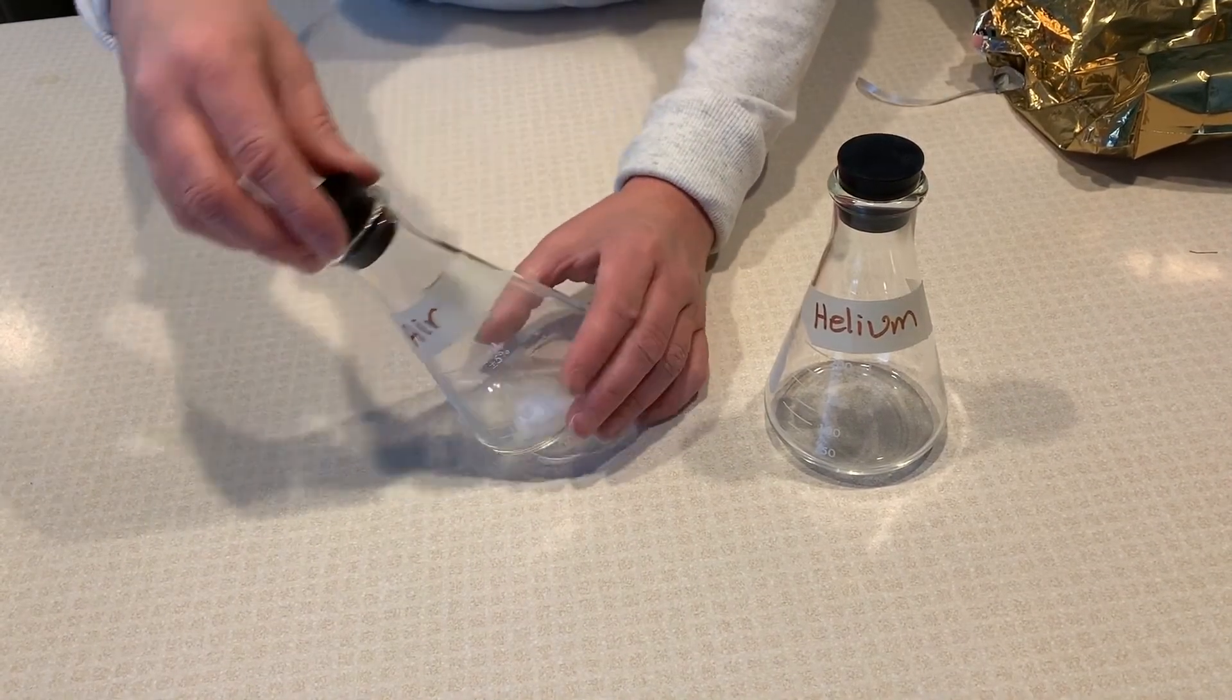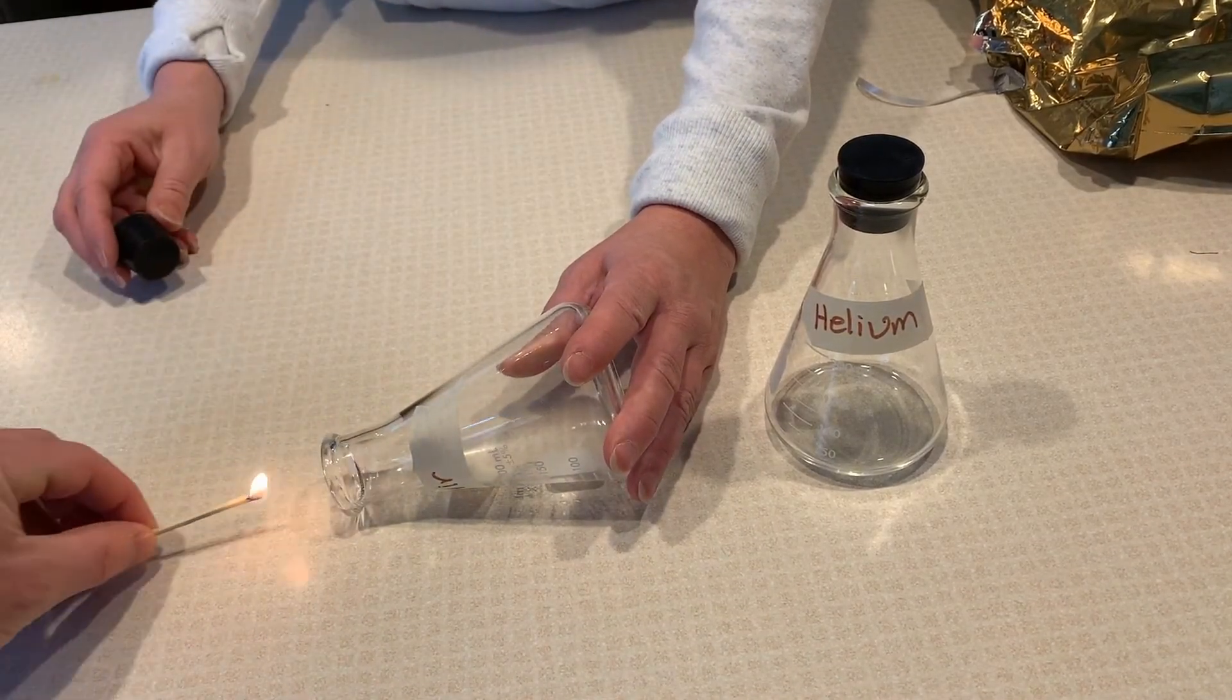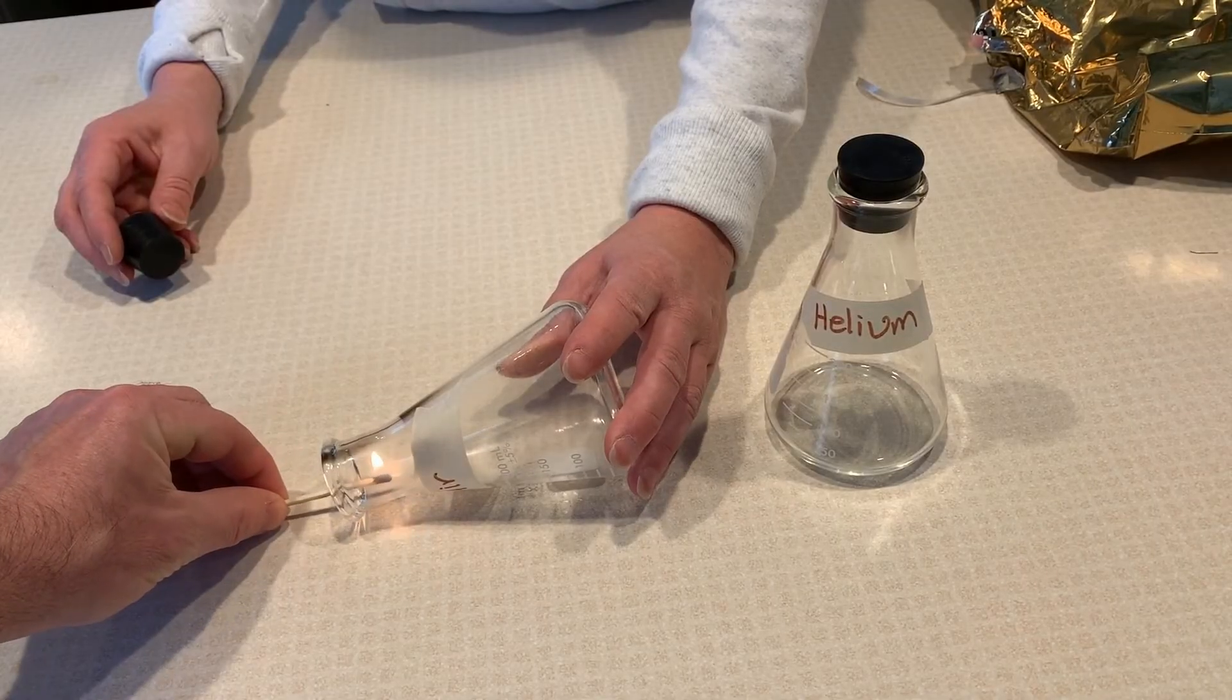We'll test the flammability of air first and put the match in the air. Notice what happens.